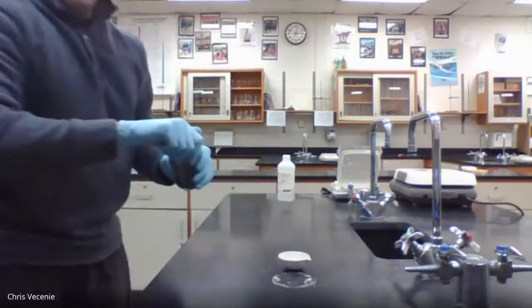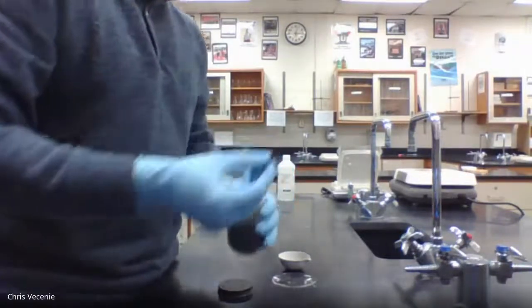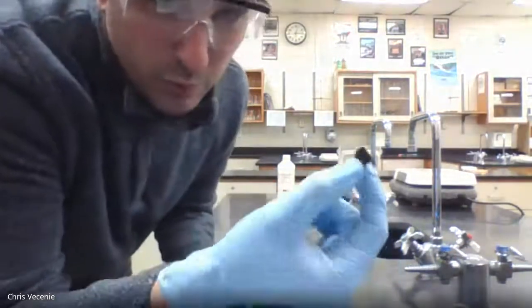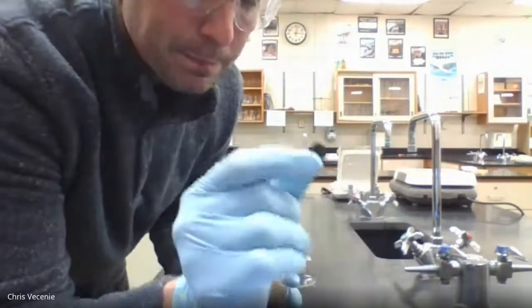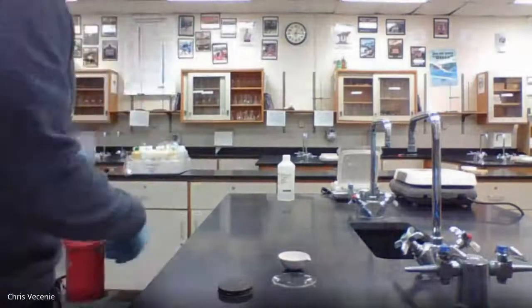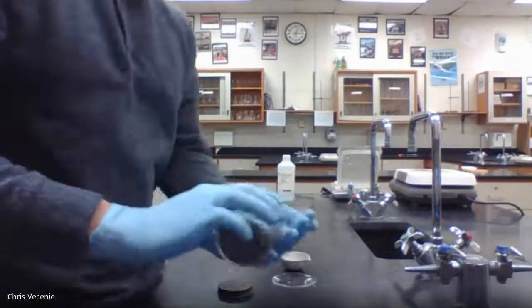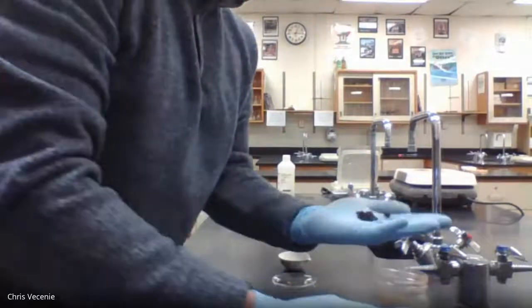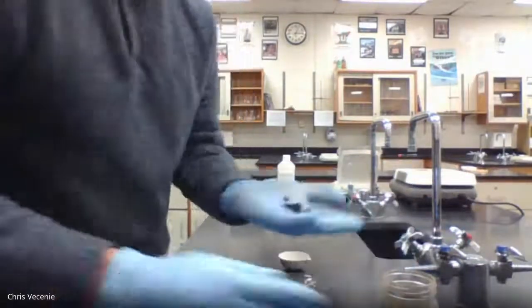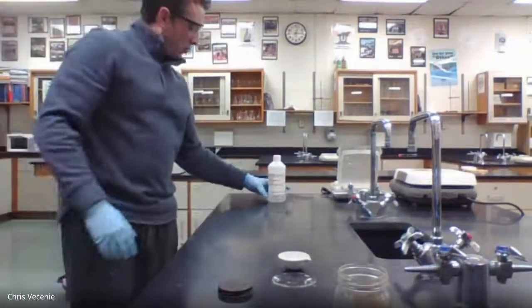All right, here's my manganese. And if you've never seen it, it's just a little black chip. We're going to break one of those chips down. But the good news is, because we've done this before, I have some smaller chips that we can use to get the mass we need. All right, here's my hydrochloric acid.